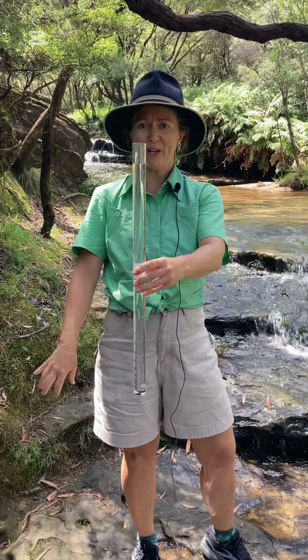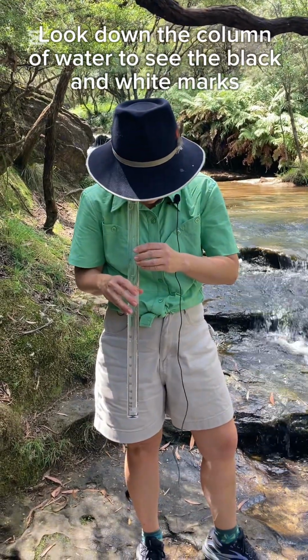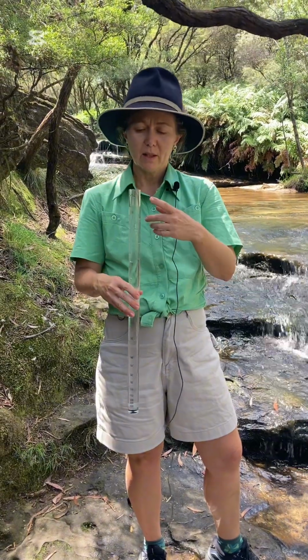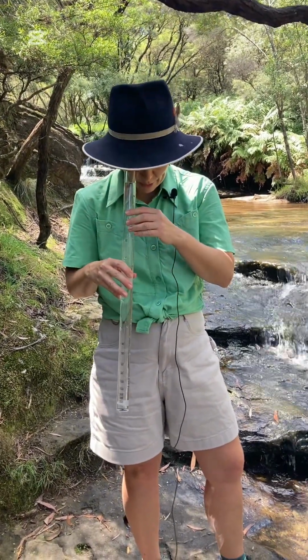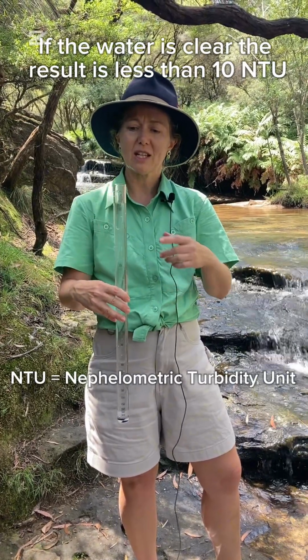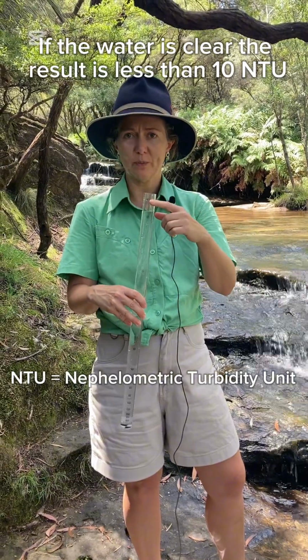And we have as much water in that column of water as possible. The next thing that we're going to do is look down through that column of water so that we can see that black and white marking on the bottom. If the water is quite clear, which it is today, I can look down through there and I can see that marking, so that I would be happy that the measurement would be less than 10 NTU.